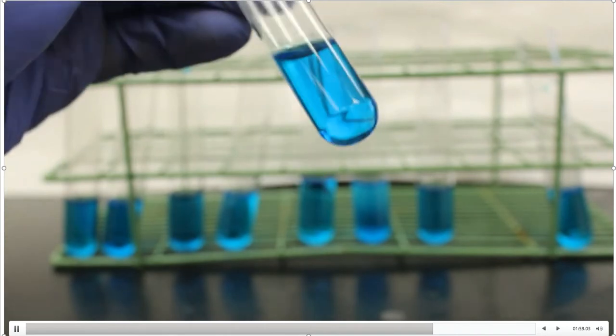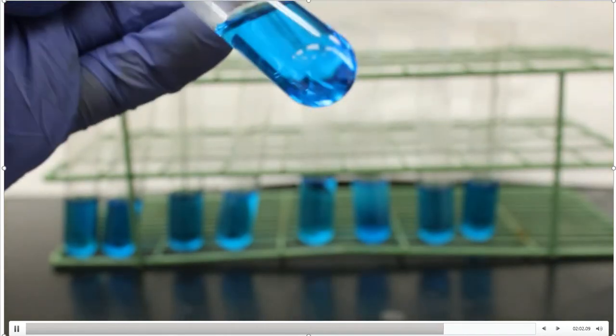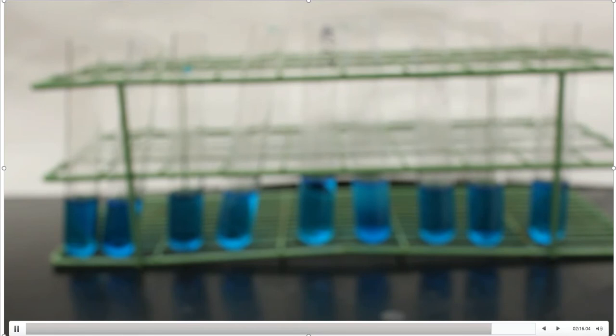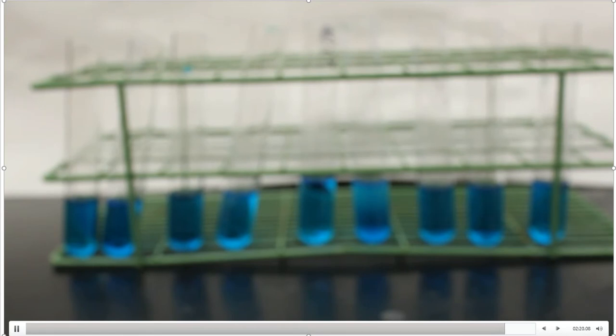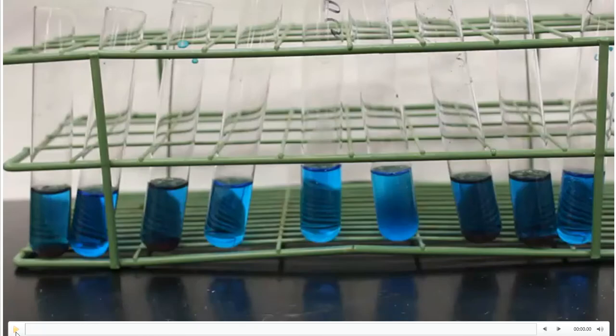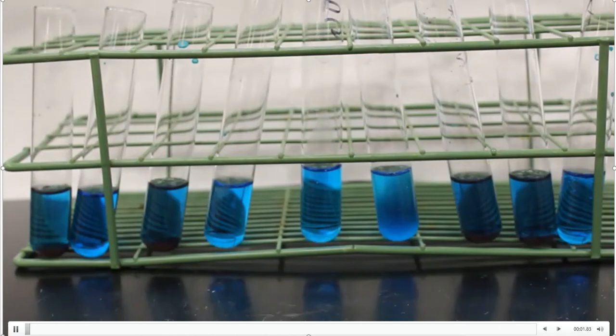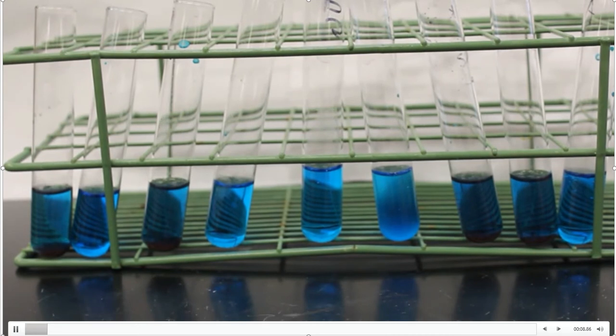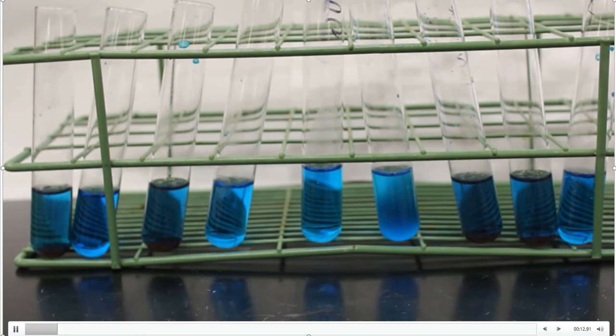Now the directions tell me to put the ones that did not form a precipitate back into the hot water bath, but quite honestly the ones that already formed a precipitate won't be hurt either. So I'm going to put the whole rack back into the water bath for another five minutes. So we're at the end of the second five-minute heating period. I'm going to go through them all again — you know which ones turned in the first five minutes, and now we'll see if any extras have turned as well.